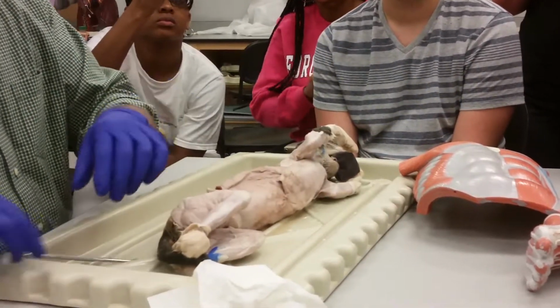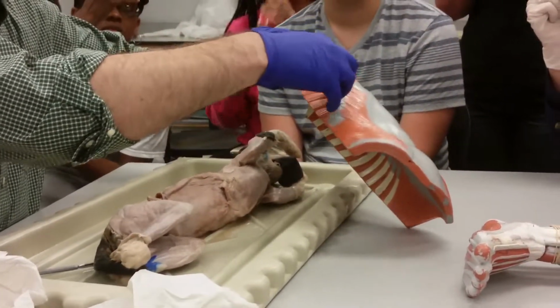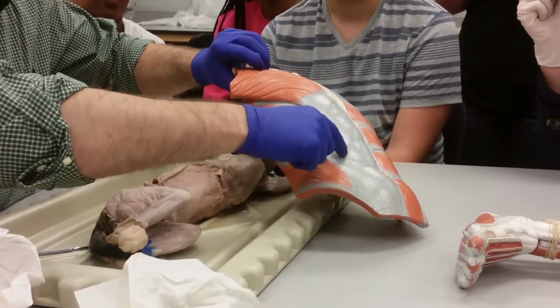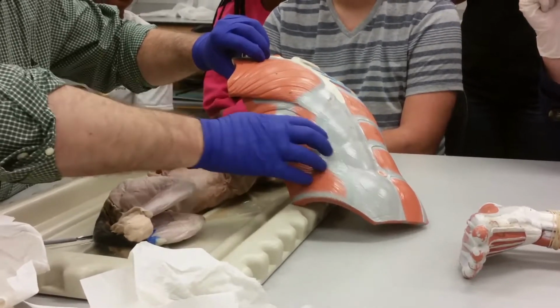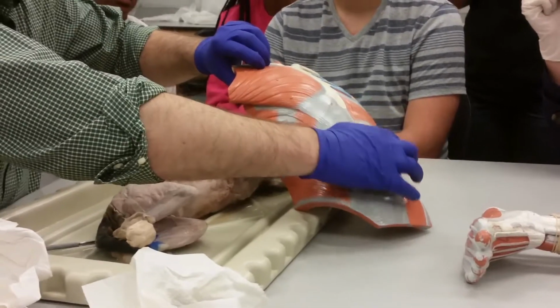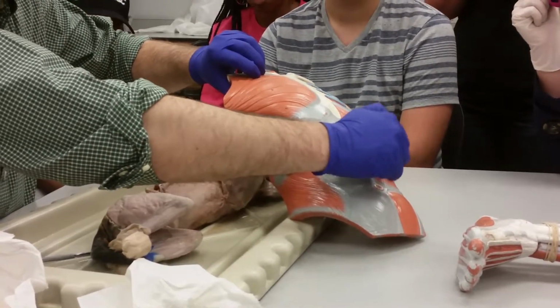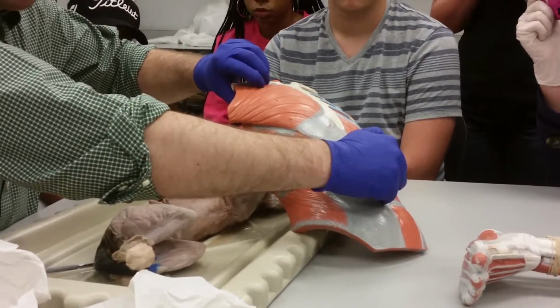So this muscle we're talking about, which proceeds from the lateral side on the outside, is the most superficial of these, and it comes down at an angle. The belly of the muscle, the fibers, terminate at the edge of the rectus abdominis. But its aponeurosis continues over the top of the rectus abdominis and ends at that linea alba. Now that's not a bone, that's just a common insertion point. So if both muscles pull on that linea alba, it tightens the anterior of the abdomen, it compresses the abdomen.